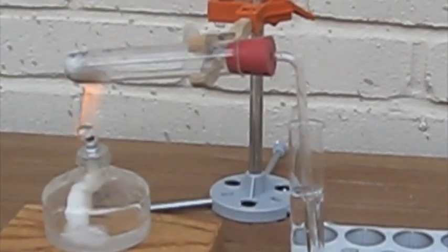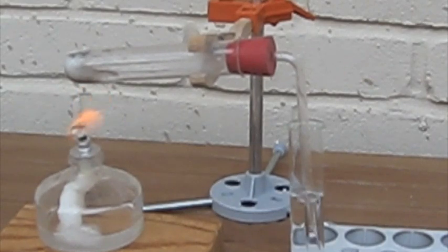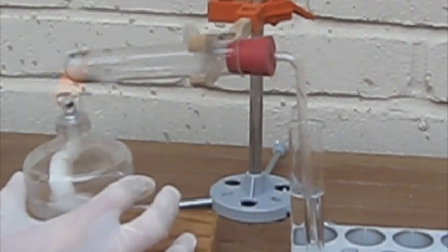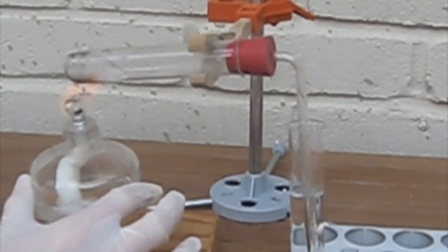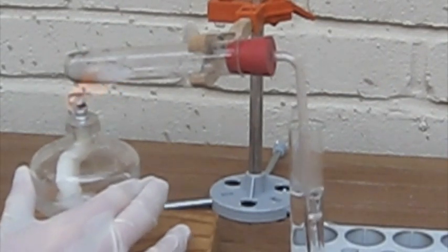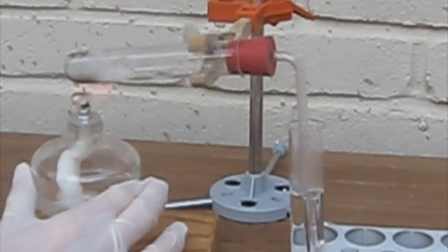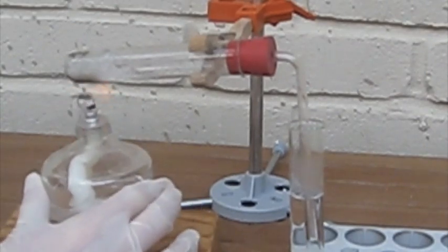I've sped this video up because it takes a bit of time for the hydrogen chloride to be produced and bubbled into the water. You can see the contents in the test tube is rapidly bubbling, and the water is rapidly bubbling too.